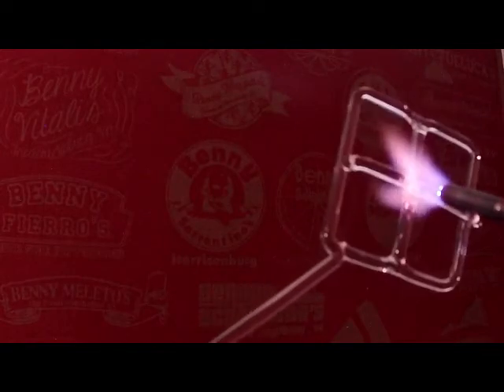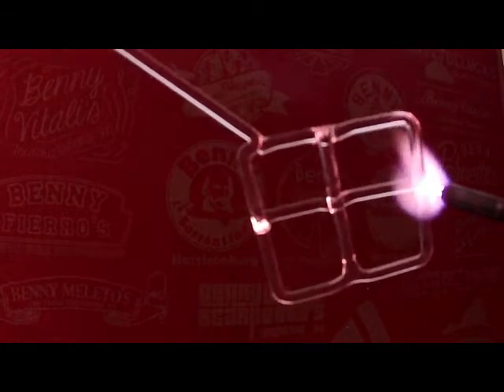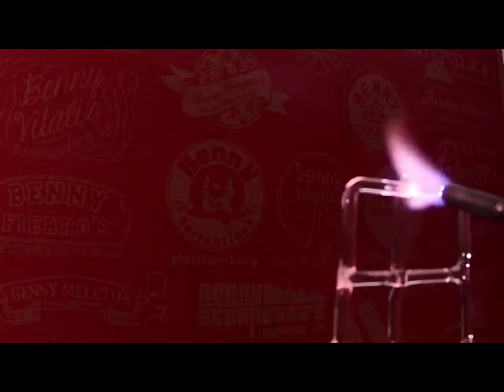Now that I've got the center two rods touching each other, and again, they're partially welded, I'm gonna come back to the ends and start heating those more strongly to clean up those welds. And I'll be alternating back and forth between these three welds, the top, the middle, the bottom. And again, if nothing else, this is excellent practice for working in the flame when you're at a weird angle. Most of the operations you're doing, you're holding the glass rod like this and you're rotating. Because everything that I'm working on right now is not necessarily on axis, I have to just move it around and adjust.